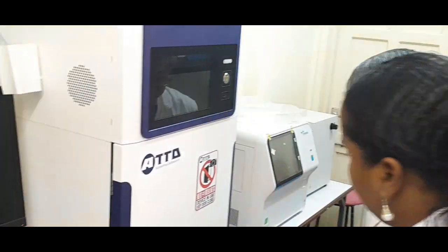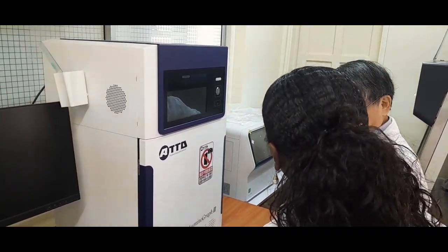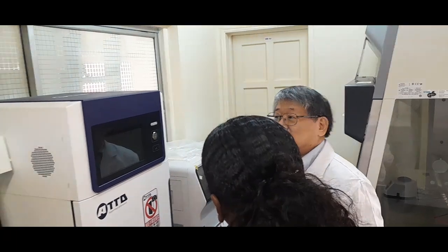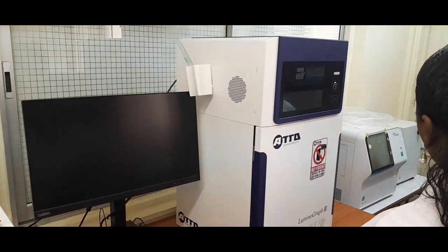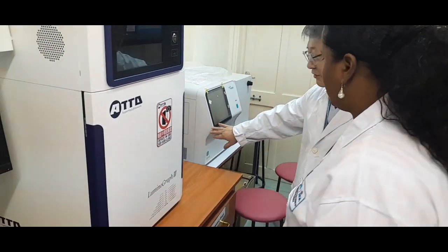Okay? So then that's the emergency exit door, in case a fire happens, because most of the material is wood, so we prepared for that. So the exit, and also, yes.